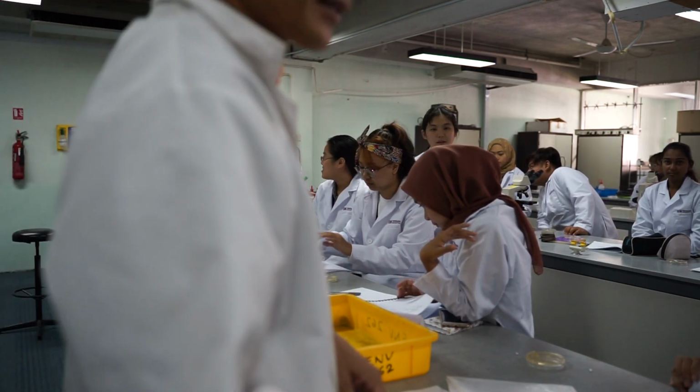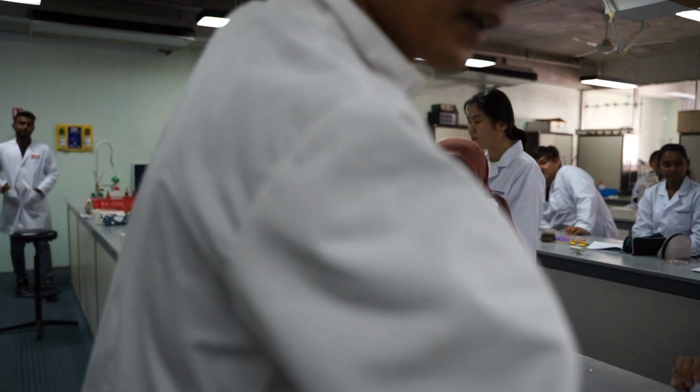One second, Ida, do we have an extra plate? Is there one? Can I have it?